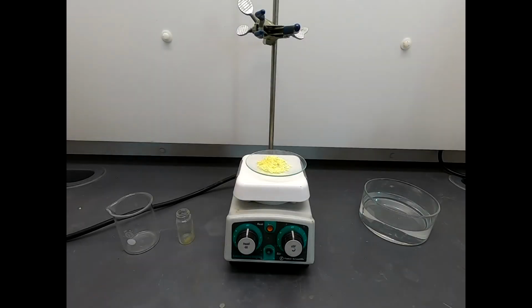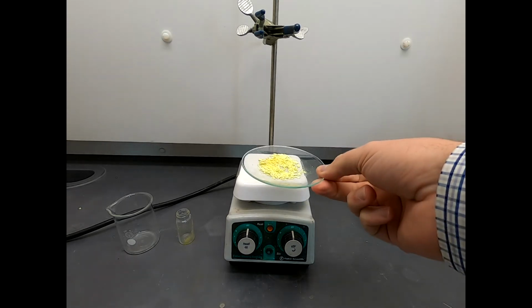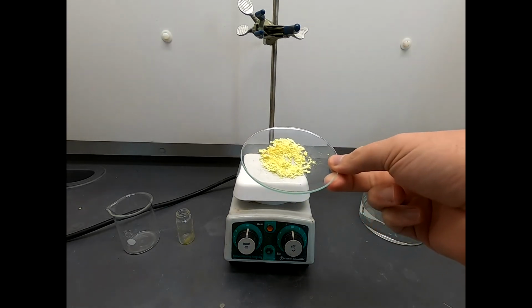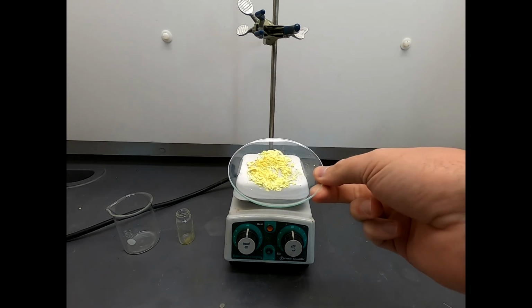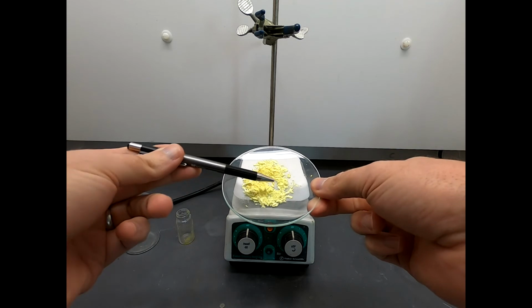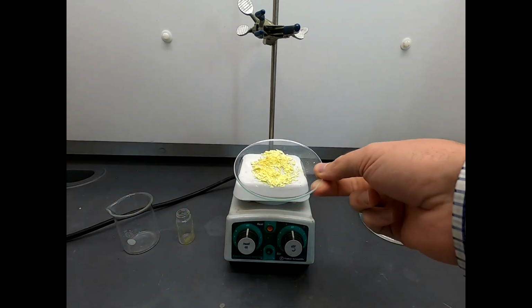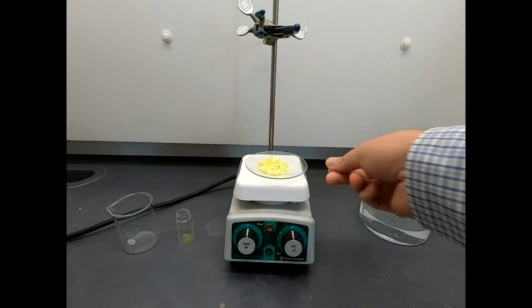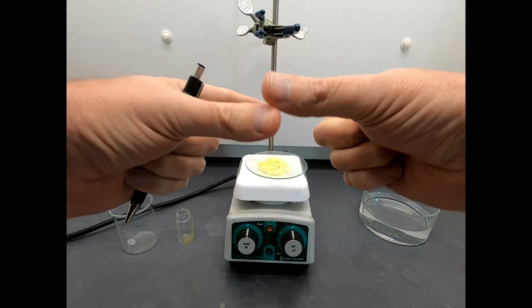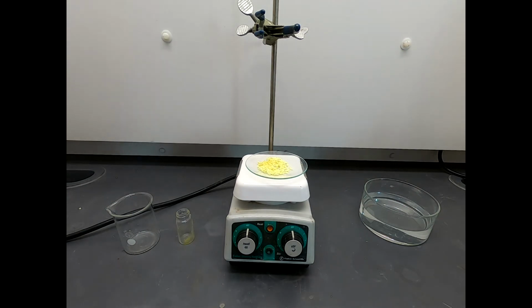So this solid has now been spread out on a watch glass and allowed to dry. I'm not sure if you can see, but it is not 100% uniform in color. The edges tend to be a little lighter. In the middle, it's maybe a shade darker. That is, when it was on the funnel, there were some thicker areas, and maybe those areas didn't get rinsed out quite as well.